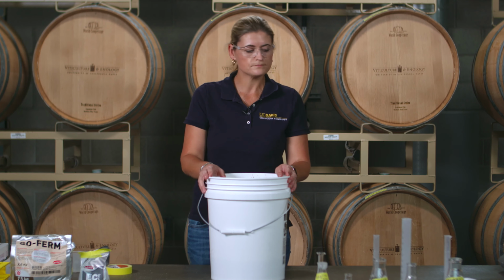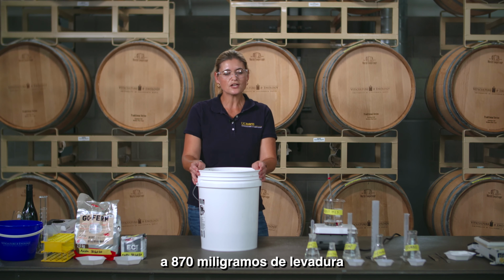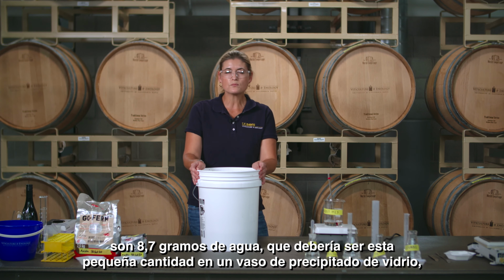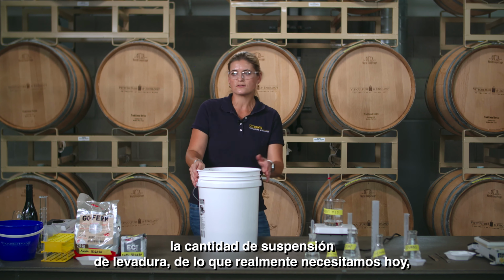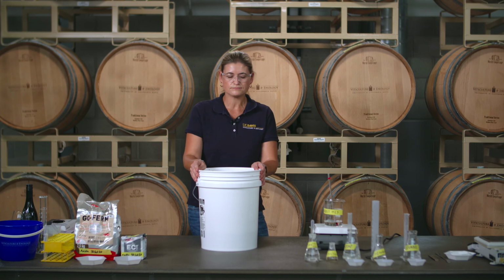So the yeast rehydration protocol is usually to use an amount of 1 gram per gallon of yeast, and you may use 1 gram per gallon of nutrient in your water to prepare your yeast slurry. Now, for only 3.3 liters of juice, that calculation comes down to 870 milligrams of yeast, and as you rehydrate that in 10 times the weight of water, that is 8.7 grams of water, which would be this little in a glass beaker. For that reason, I am making 10 times the amount of yeast slurry than we actually need today, and only a tenth of that will be added to our must.